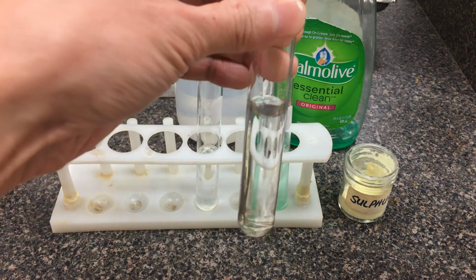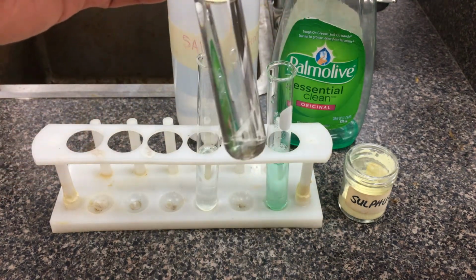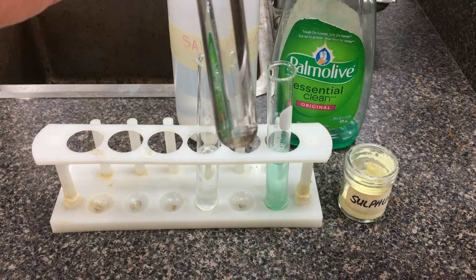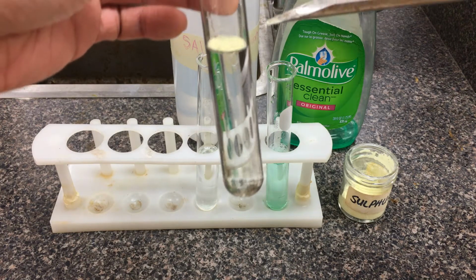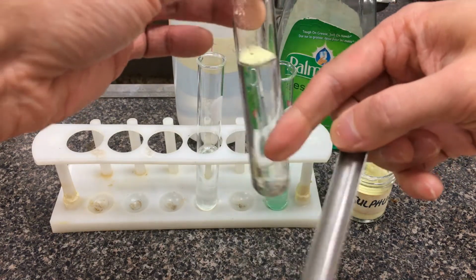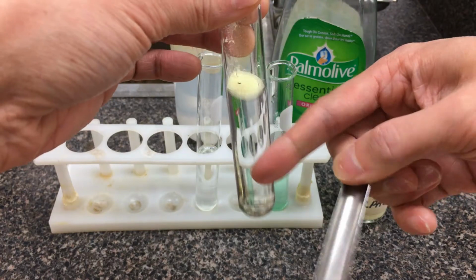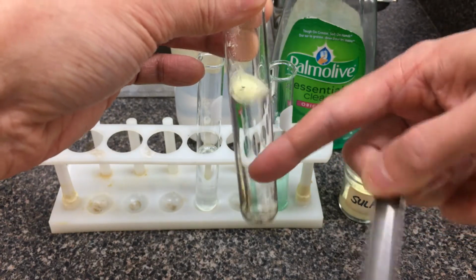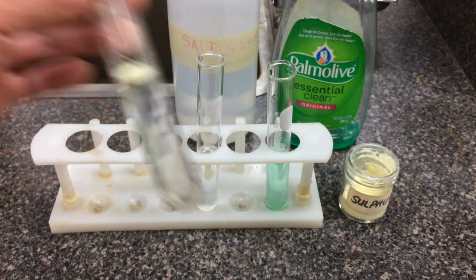So we'll start off with a little bit of sulfur powder here. So this is just in water. Okay. So you notice that the sulfur powder pretty much sticks on top of it. The intermolecular forces in water here are good enough to actually keep the sulfur powder on the top. I'm going to give this test tube here a tap, and see if the sulfur actually will fall through the liquid. So just make some observations there.